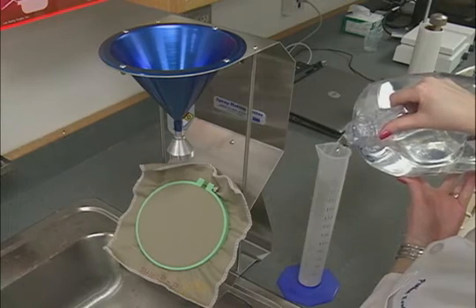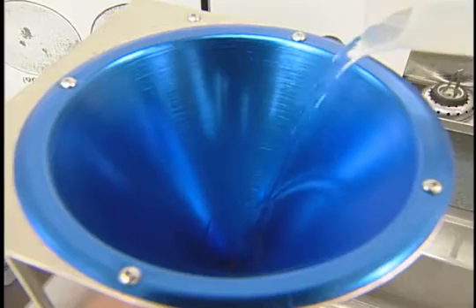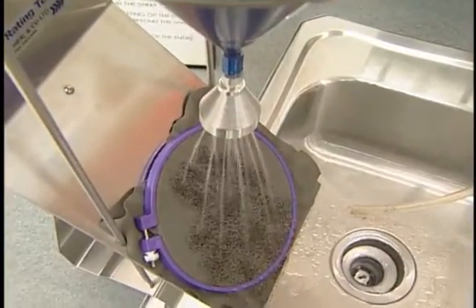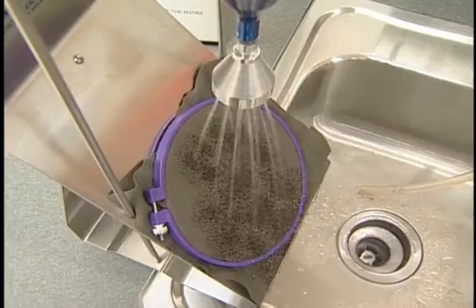Distilled water is poured into a 250 milliliter graduated cylinder. It is suggested that a practice run be performed before starting a real test to practice pouring water into the funnel so that all of the 250 milliliter volume will be dispensed in 25 to 30 seconds.